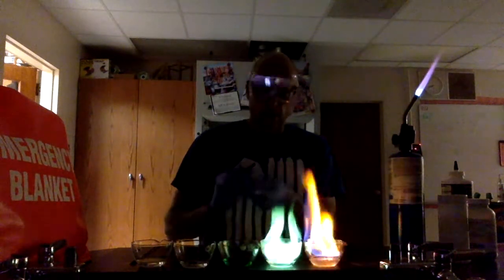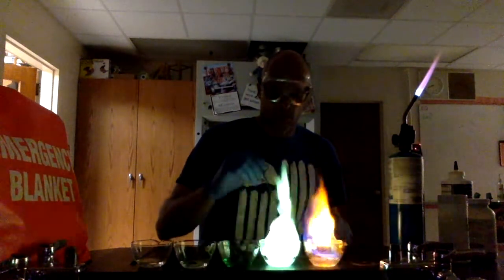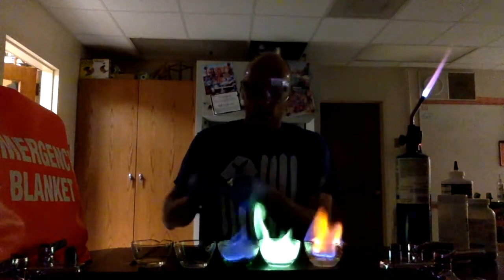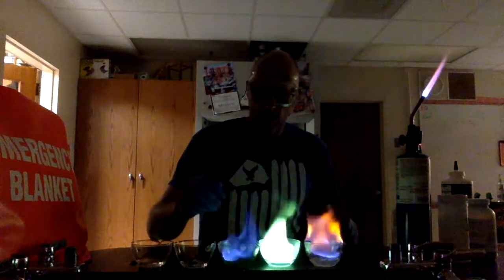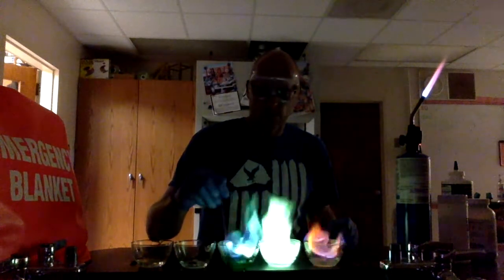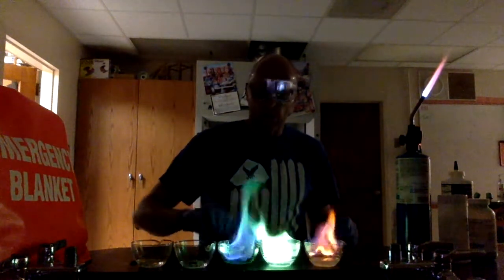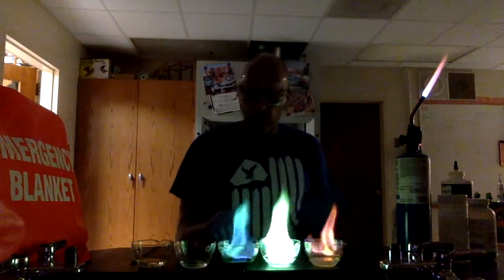There's our boric acid. So you can see these are both green but they are slightly different colors of green.